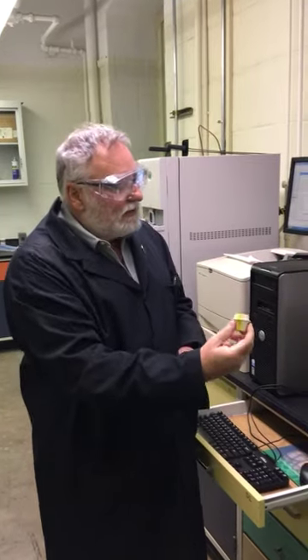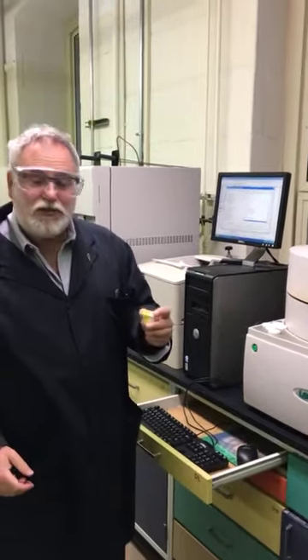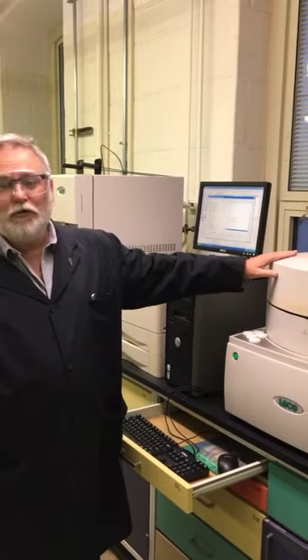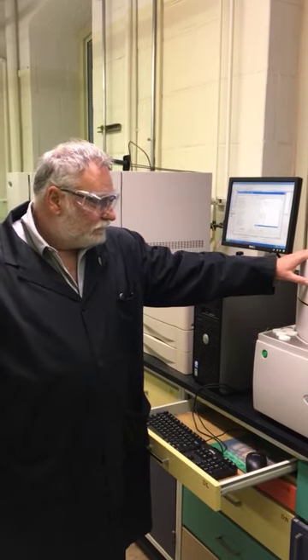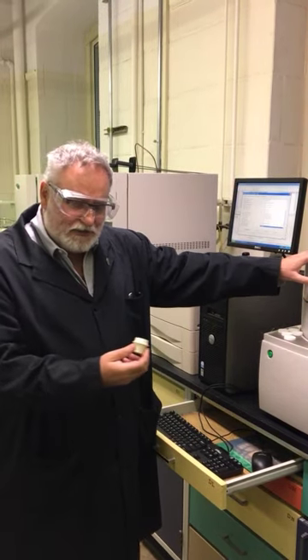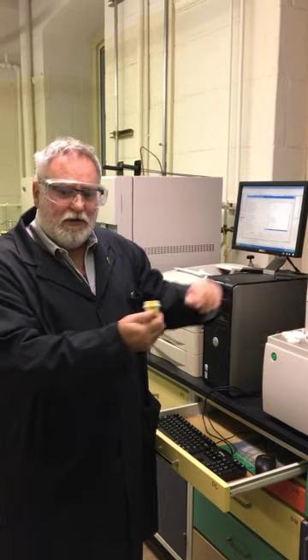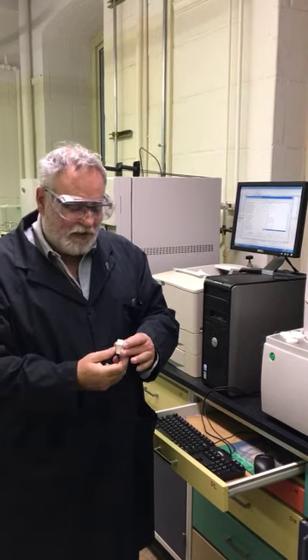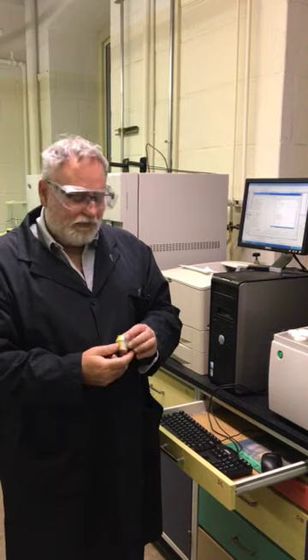So samples are placed in, the carousel goes around, it gets weighed, and then it goes through the moisture determining step. This is essentially a glorified oven with a balancing instrument. There are specific heating rates as in the ASTM. It's going to periodically go up to about 110 degrees Celsius, but read the ASTM for the actual numbers. And it's going to weigh them periodically. When they have all got to the point where there is no significant change, that is going to be considered as the moisture value.